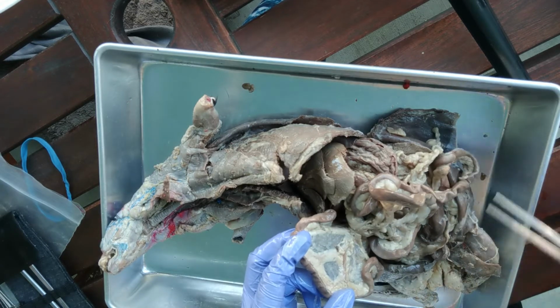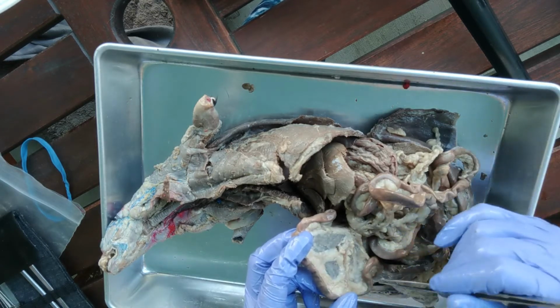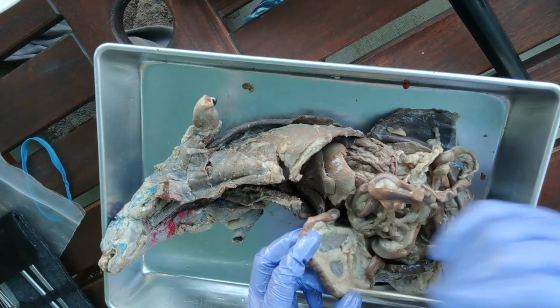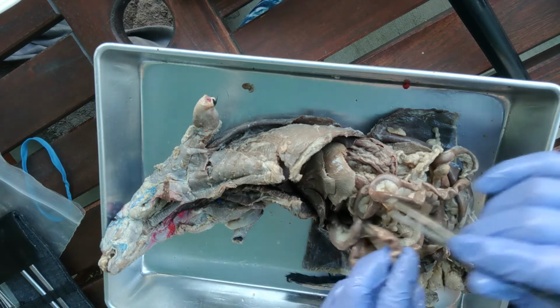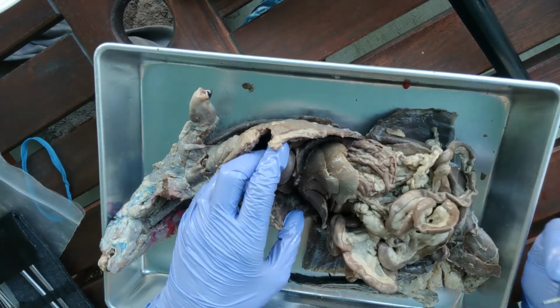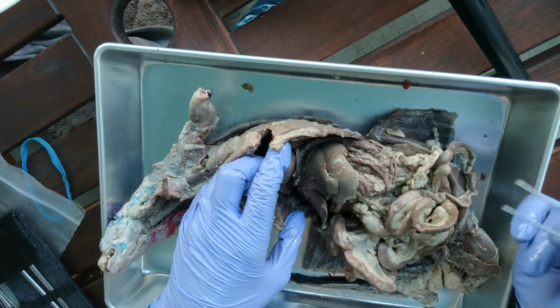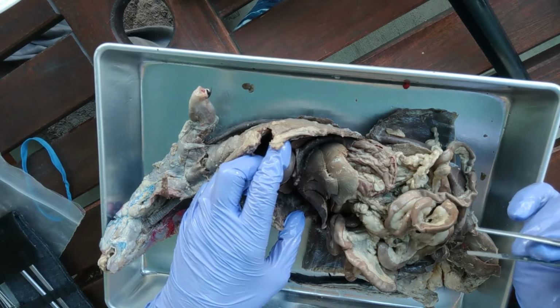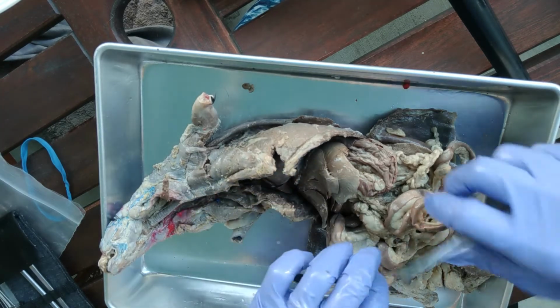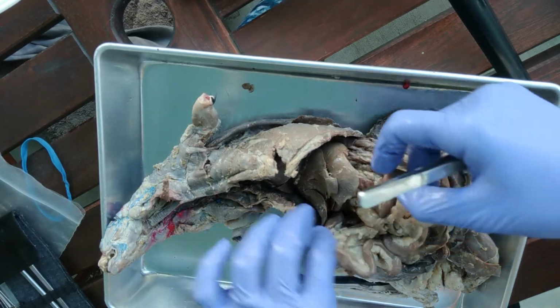These blood vessels will take the nutrient-rich blood coming off of these small intestines. So as the nutrients go out of the intestines and into the bloodstream, they're going to run up into the liver, and then the liver is going to filter out all that excess good nutrients, the glucose, the sugars, and it will store it for later. Okay, so that liver does a lot of good stuff for us.